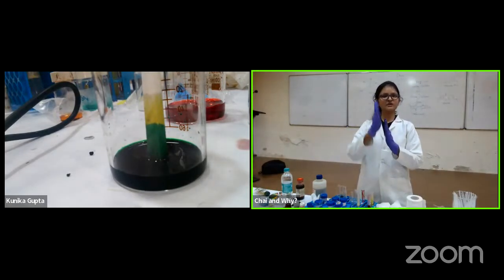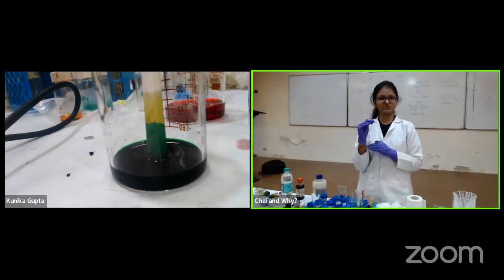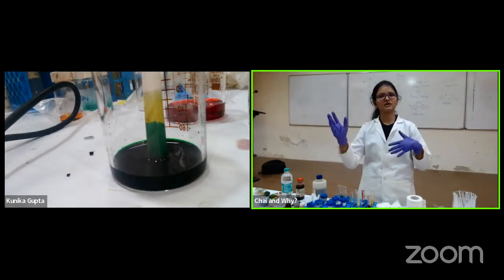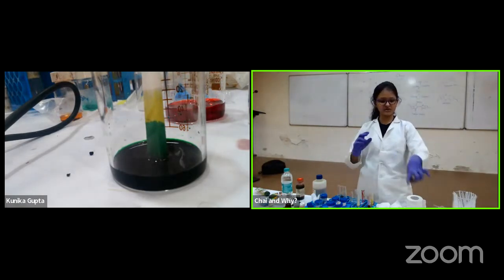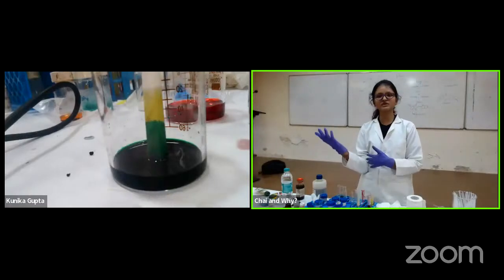We are giving them a surface to move on, and then I can see how good they are at moving, and that different distance, their speed, is actually helping me to separate the two compounds. Okay, so here it will be very simple. Break the chalk into two pieces, the green one is one part and the yellow one is another. So in the lab, you have to do a chromatography setup where you add a stationary phase, which is the chalk. The solvent is water. There are different solvents.